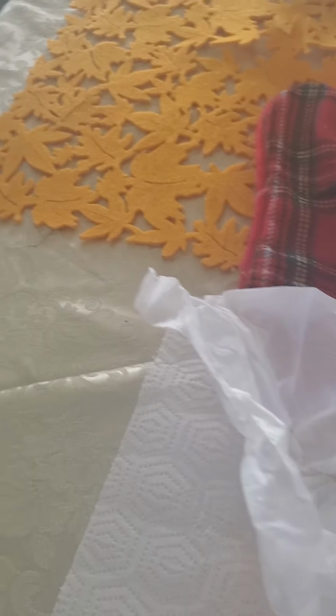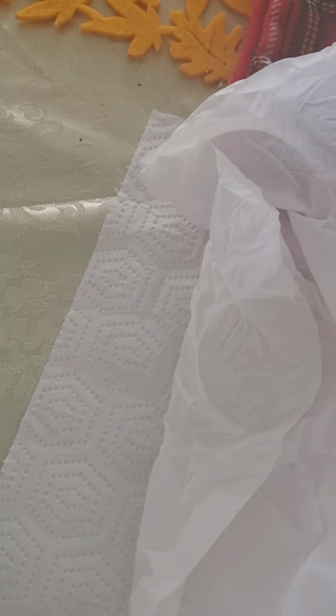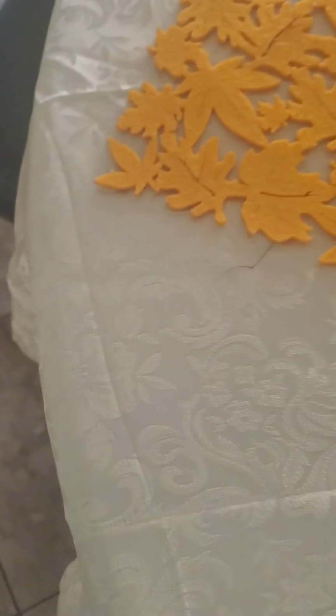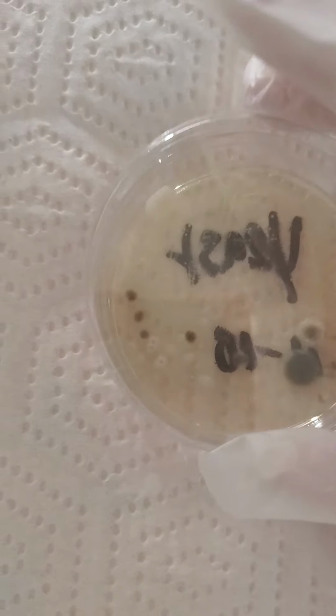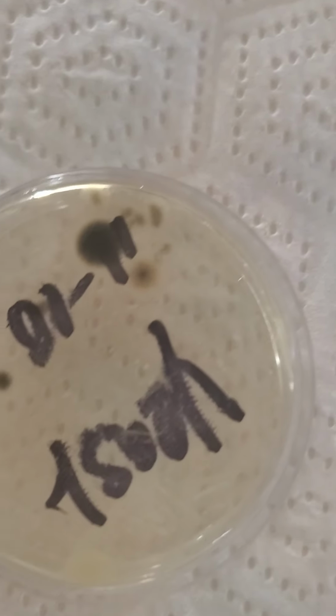And the first thing I'm going to do, so here I have my gloves, so we are able to handle the samples. I'm going to put the E. coli on one side. I'm going to get the other sample. This will be the epidermidis, and this is the yeast. So as you can see, the yeast was very successful. I was able to get a lot of the bacterial growth that we were looking for. If you turn it to the other side, you can see the growth. So that is the microbe of the yeast, or Cerevisiae.